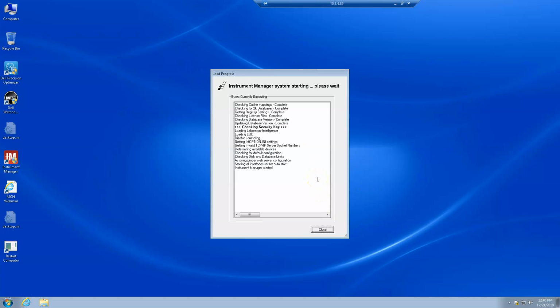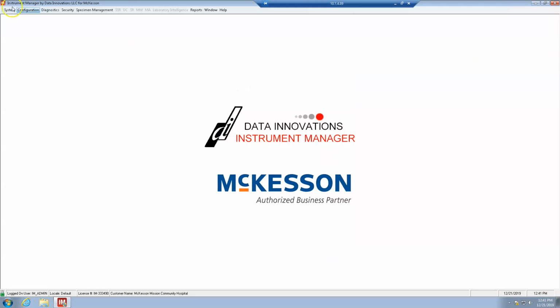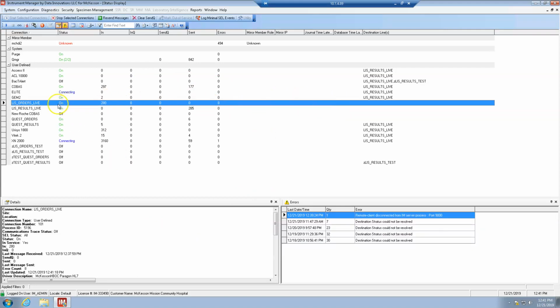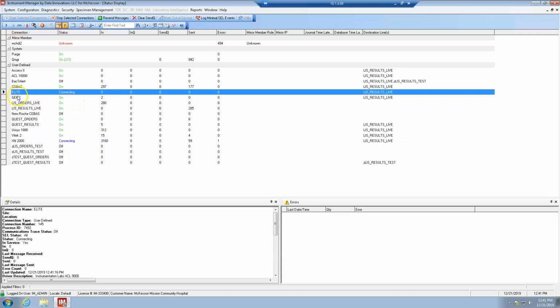Okay, and it's starting up because we restarted the cache. All right, and we're going to accept and log in. System status, bam. So this one is still trying to resolve the connection. Bam, on, cool, we're great. The XN will connect momentarily. This one's kind of slow to connect. And the Elite was already connecting, so this one's old.